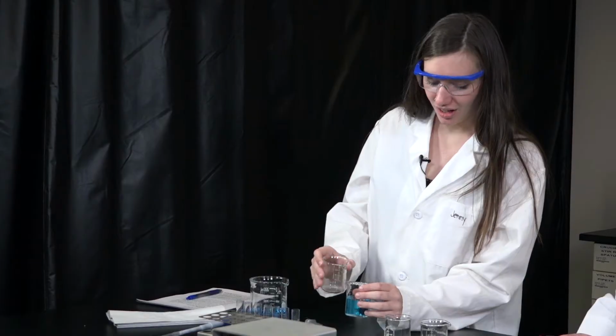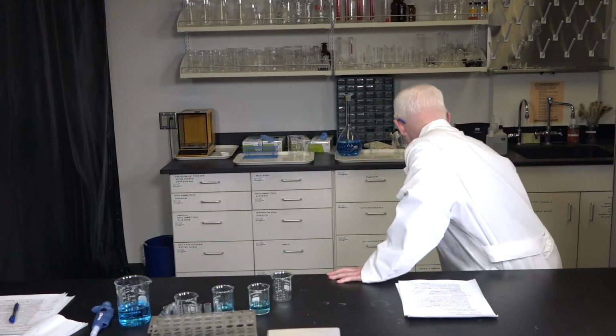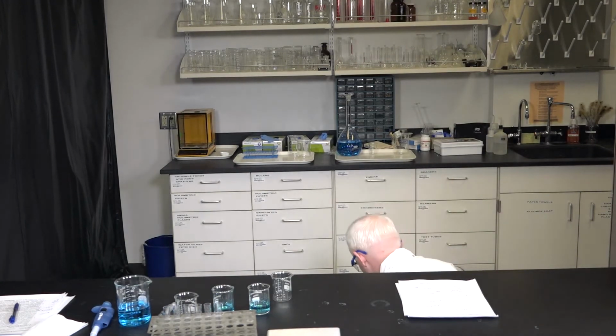So, are you ready to do the lab procedure? Yeah, I was just setting up. Can I help you with anything? Oh no, I got it. Well, what are you doing? I just gotta wash this real quick. Oh, okay. What? Relish. Are you okay, Relish?